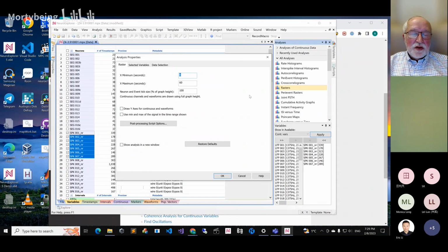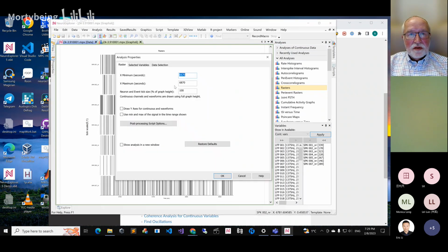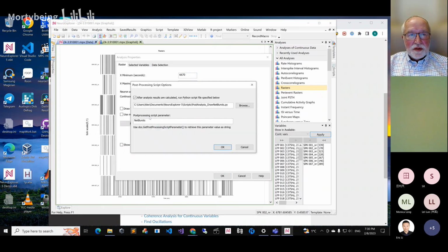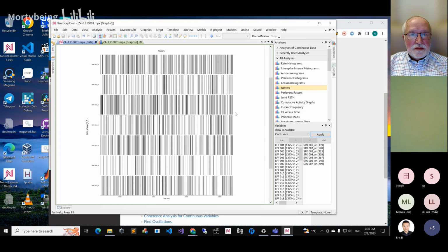Here you have to specify minimum, maximum, and that's it. It's just the time axis parameters. There's nothing else. 70. Okay. Post-processing script, let's remove it. So this is the rasters analysis.